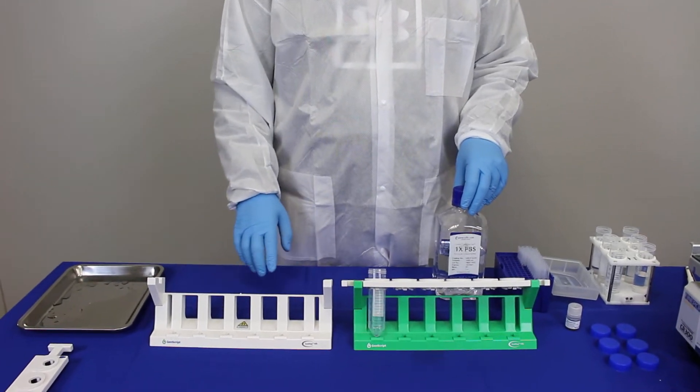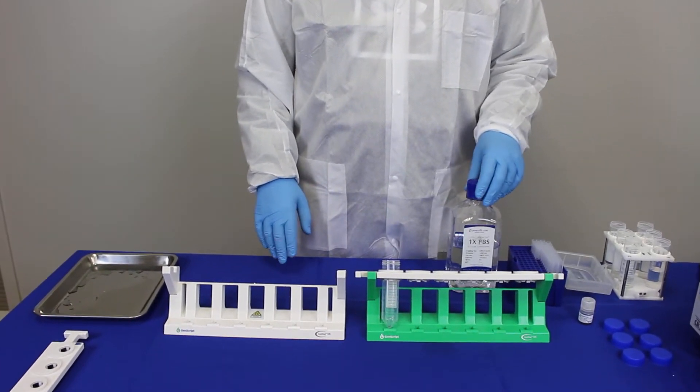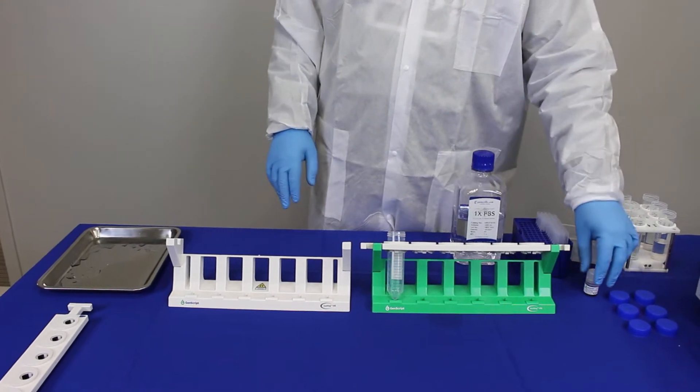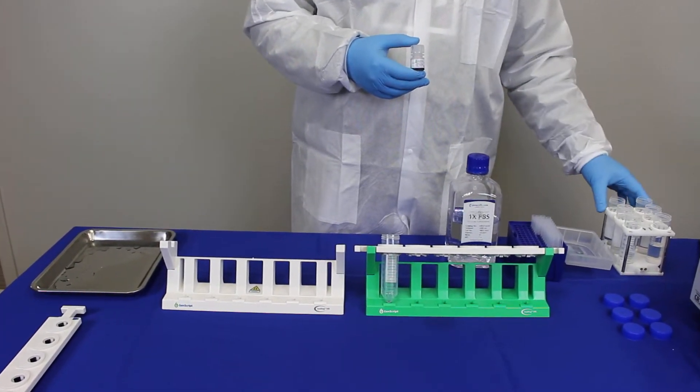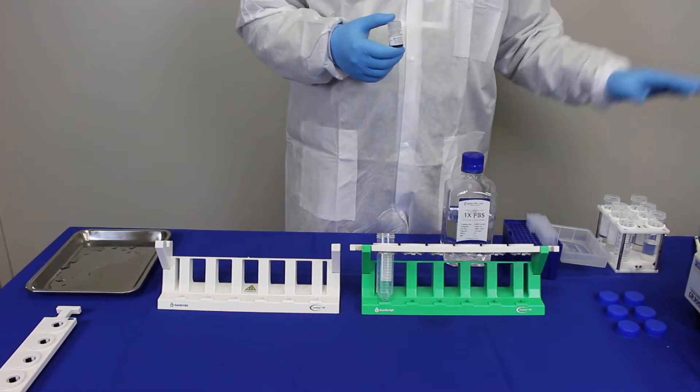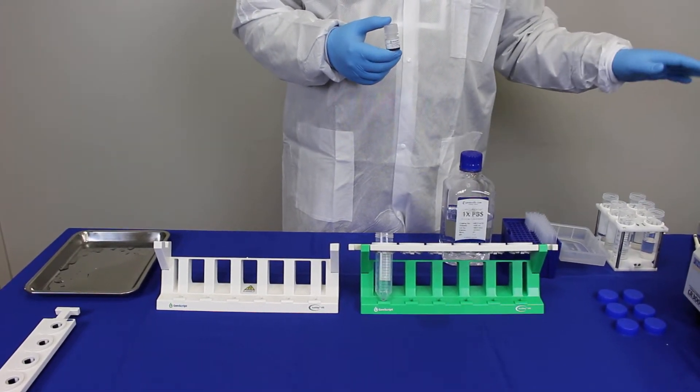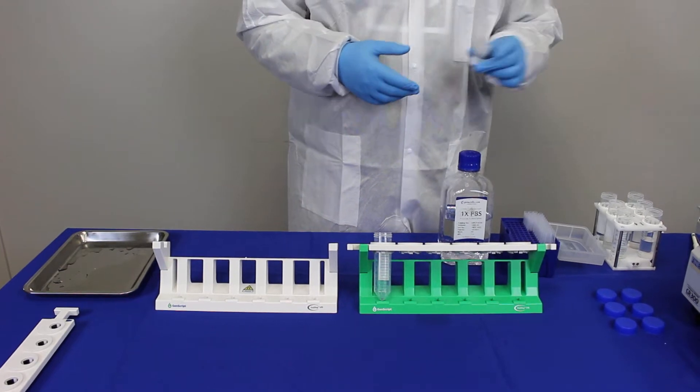So in this part of the video, I'm going to talk about how to prepare the samples and magnetic beads, put them into your samples, incubate your samples with these magnetic beads, and then finally put them into the M-Mag-SA system for purification.